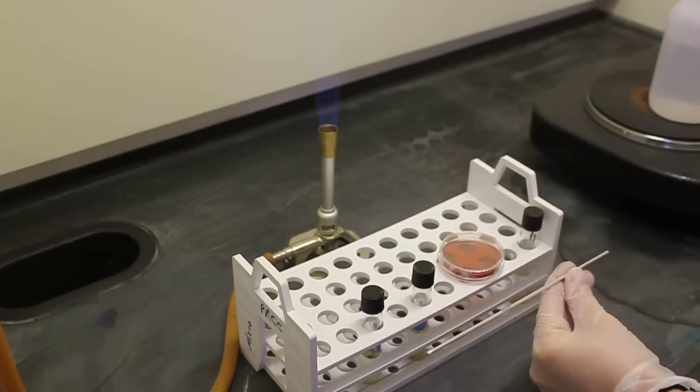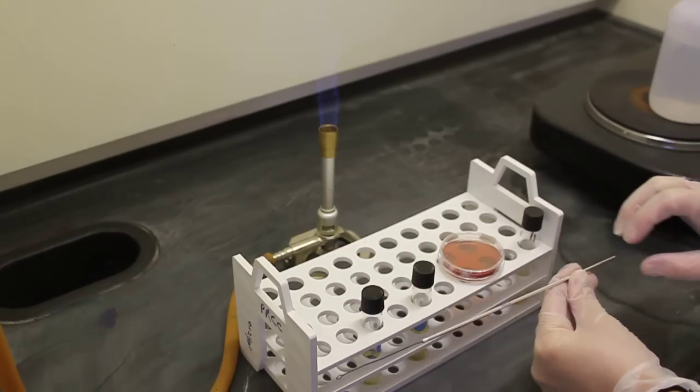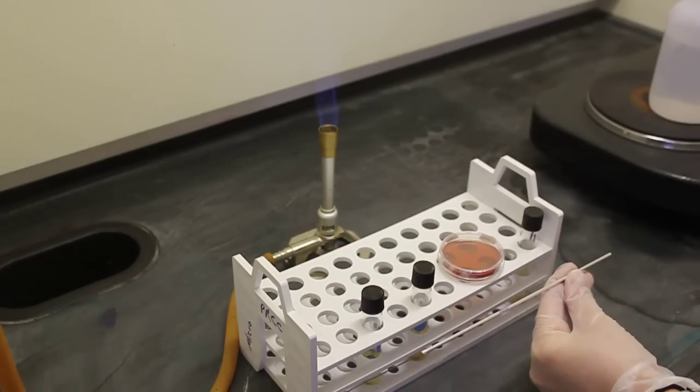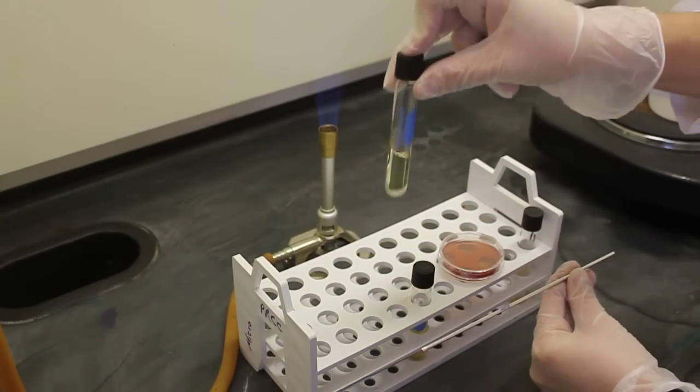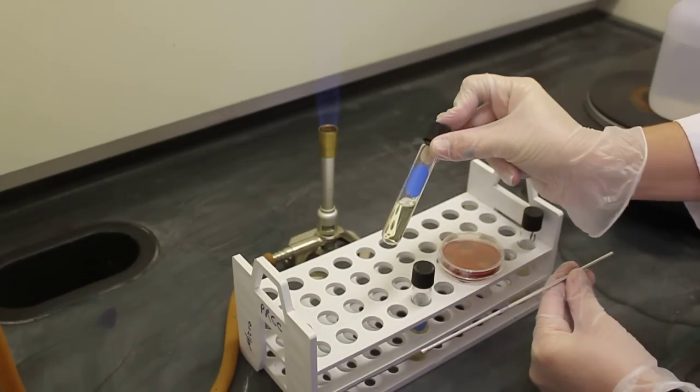I am now going to demonstrate how to properly inoculate several different types of media. There are three major types of media we use in the lab. We use liquid media in a test tube. This type of media is known as a broth.